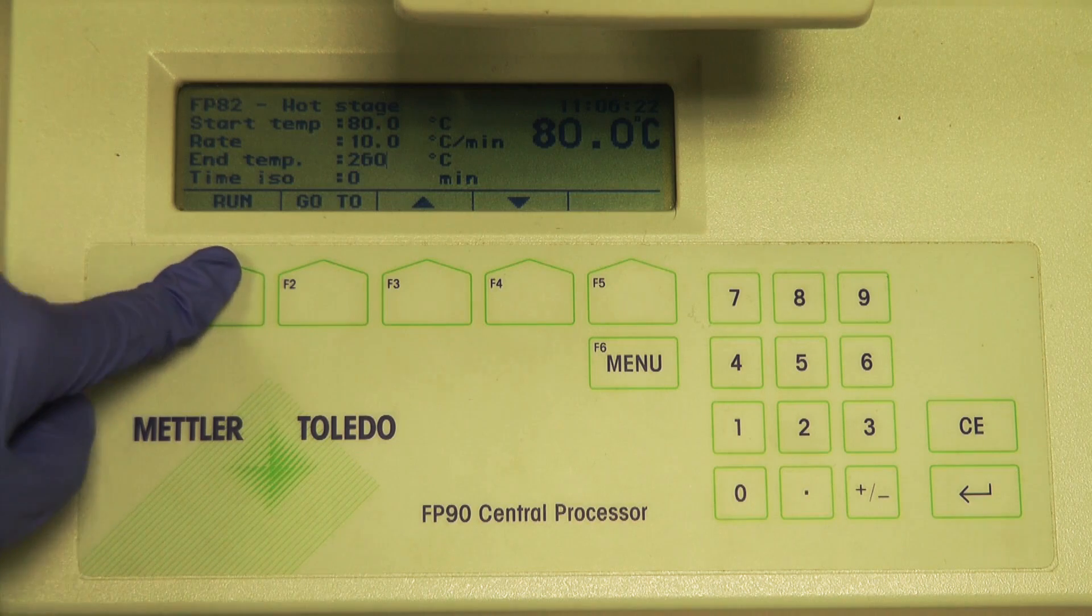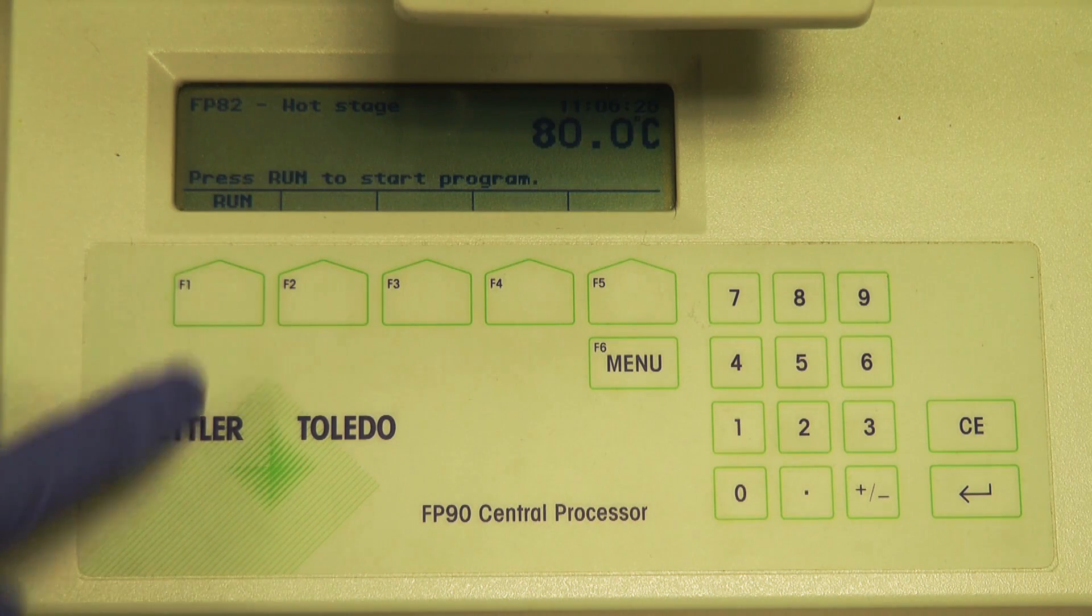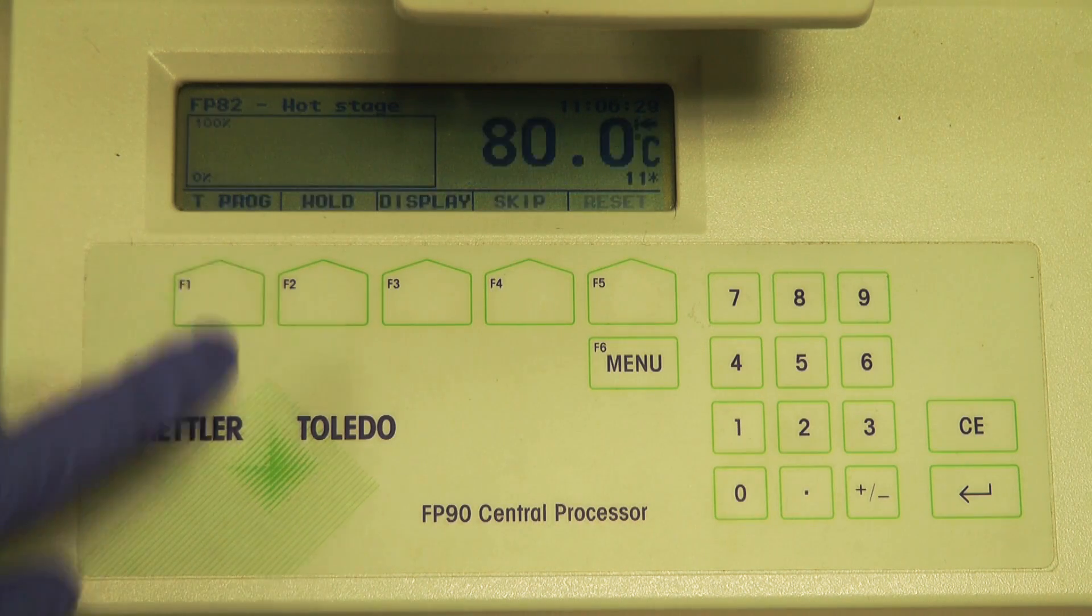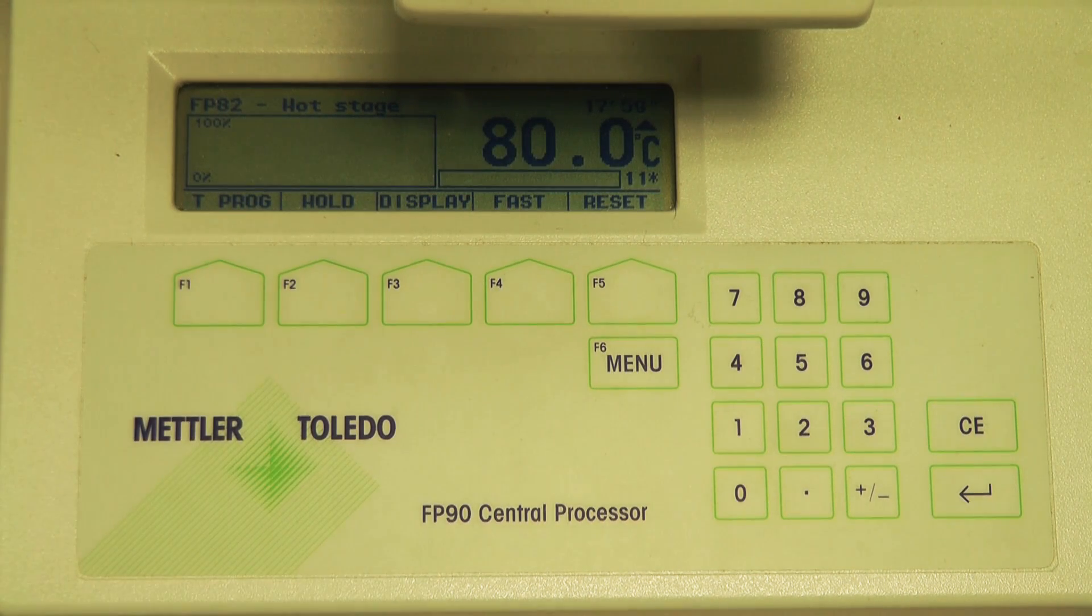Press run three times to start the experiment. Once the experiment is running, check that the video is recording, then monitor the progress.